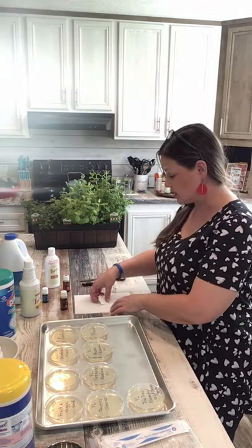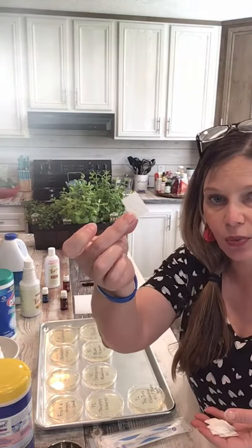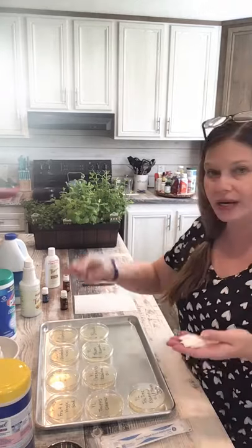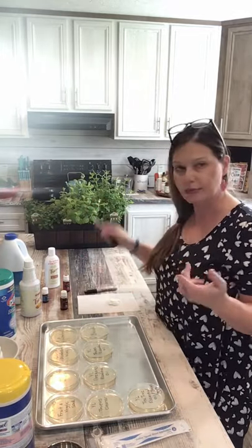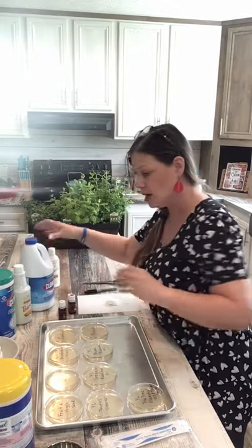You're also going to need a paper towel cut into little bitty strips like this, because this is what we're going to put the other cleaning items on, which will be put into the petri dish. I've already done that to save time. I labeled everything with a black marker, used scissors to cut the paper towels, and I have all my items here. Let me go run and swab the bottom of the shoes and the toilet and I will be right back.